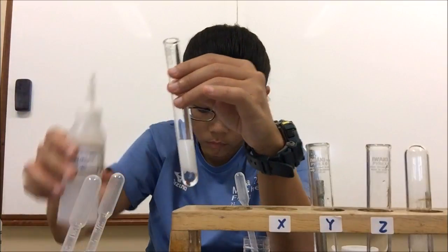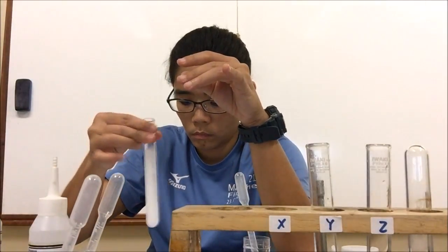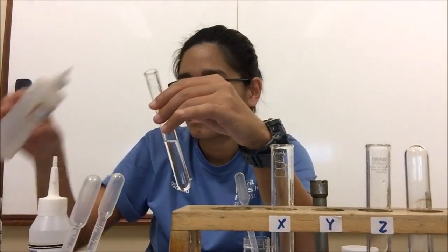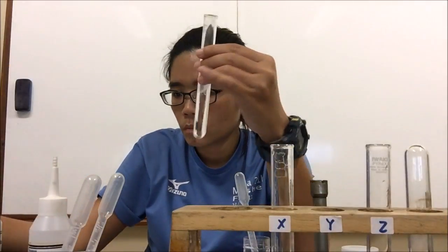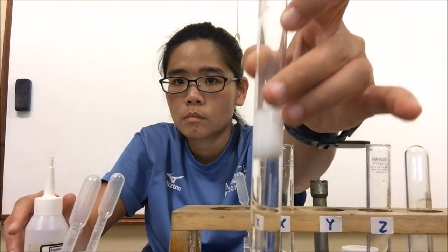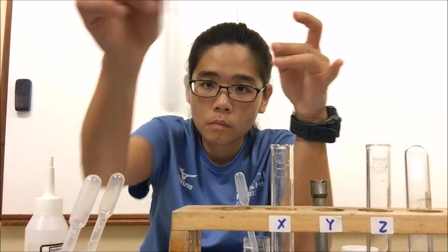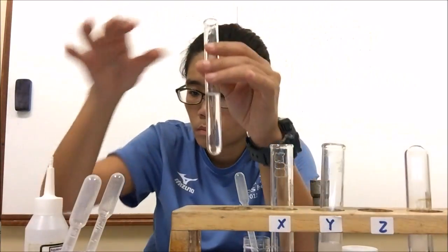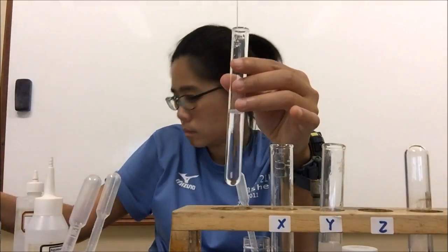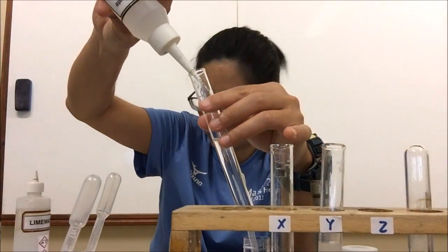We do the same test for solution Y, adding barium nitrate. Then we test solution Z: we add nitric acid first, then barium nitrate, and the colorless solution remains — a negative result for sulfate. Therefore Z does not contain sulfate. We go on to the next part of the experiment.